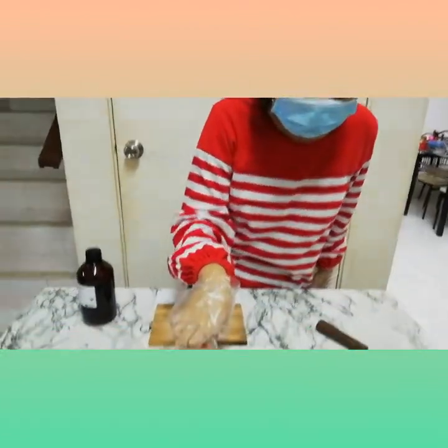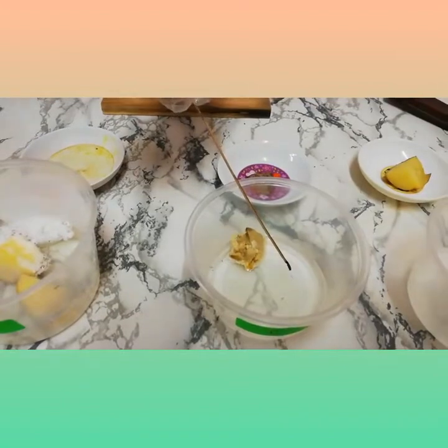We're gonna put it in container C and we're gonna see what happens. Oh, it burned off completely, so this means that there's actually no presence of oxygen in here. And now we're gonna put it in D and we'll see what's gonna happen. And yes, it burned off completely again. And just like before, there is actually no presence of oxygen in here.